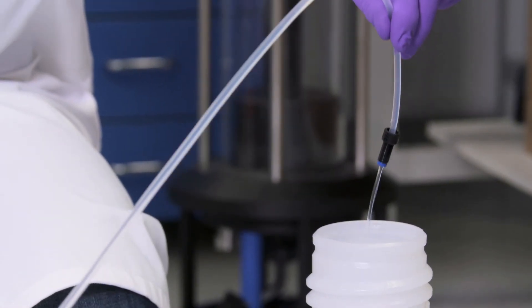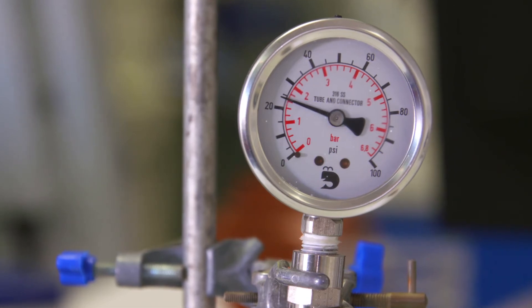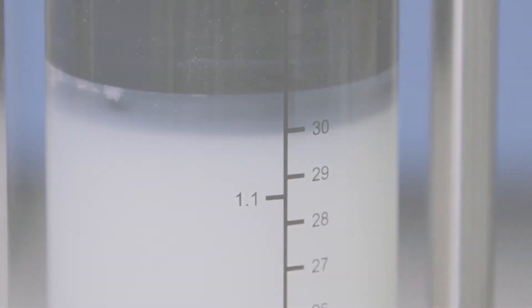Reattach the adapter to your pump or system and open the bottom outlet. Continue to flow for a further column volume to ensure no further compression. Your column is now packed, ready for your purification needs.